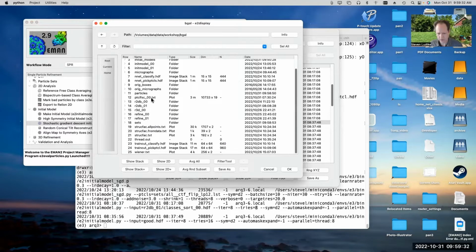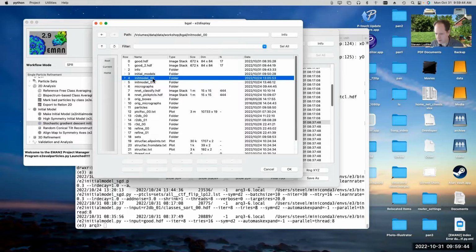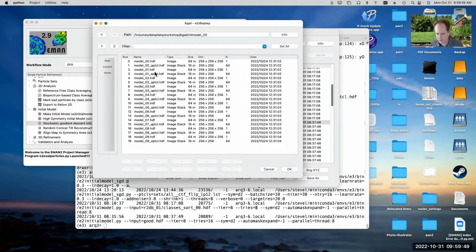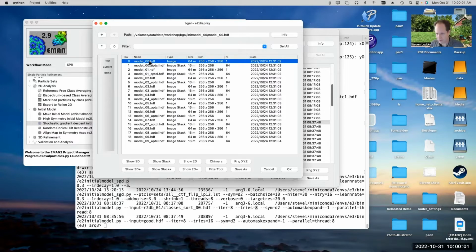Anyway, so I ran that twice. Unlike the other program, which generates sequentially numbered files in the same folder for each iteration, this new program follows the more conventional approach of each time you run the program, it makes a new folder. So if we look at init model 00, we'll see the 10 models that I generated that run, and there are only 2 files for each one here. There's the A particle file again, which lets you compare individual particles with the corresponding projection, and then there's the 3D structure. Now this file, if you're using raw particles rather than class averages, isn't as useful.